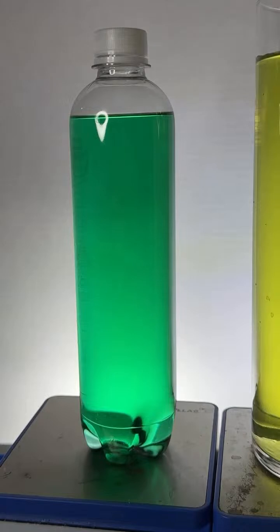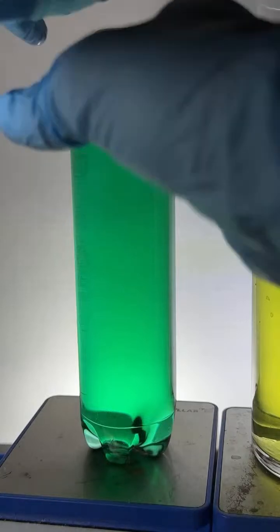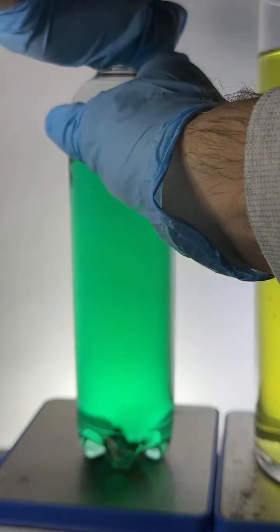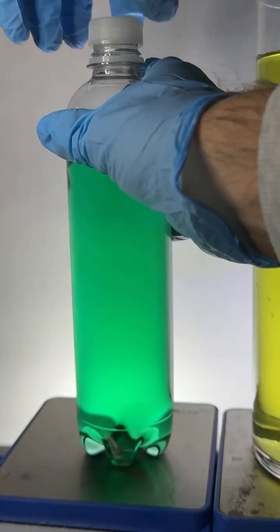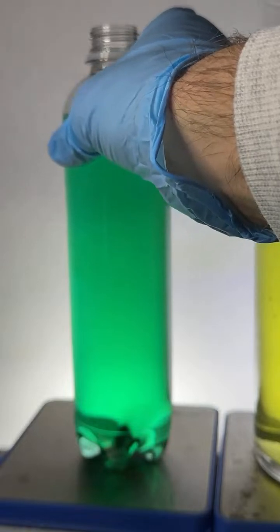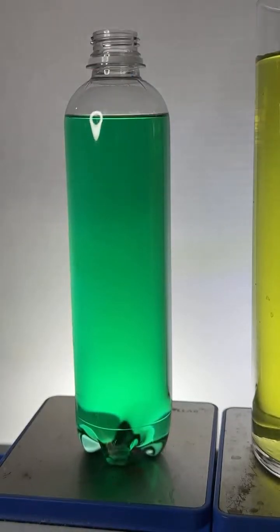Does the yellow in the smaller cup have a higher HC? I don't know what you mean by HC, Pablo. I apologize, so I can't answer the question. Nope, not going to happen there, Pen. But I do that in a safe manner in a hood. If you want to check that out, you can check out some of my short form videos on my YouTube channel. But I'm not going to do that in an unsafe manner.